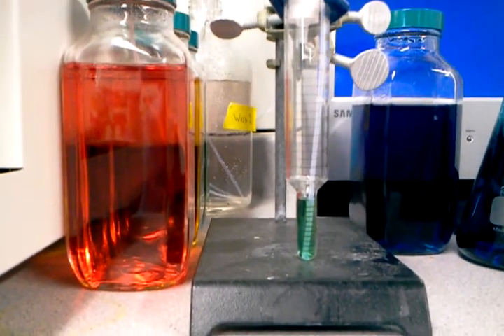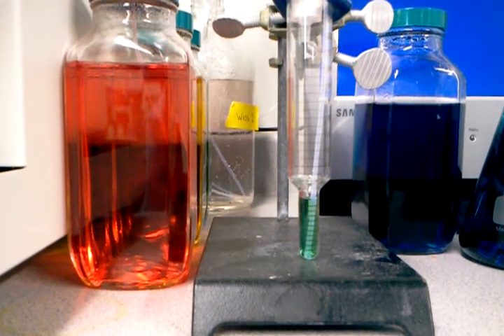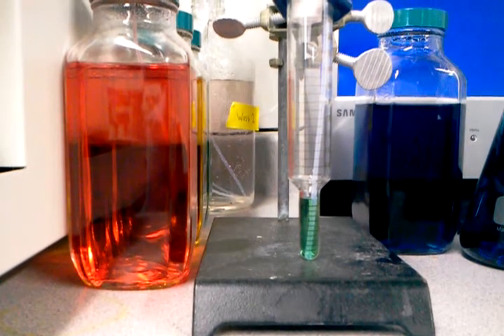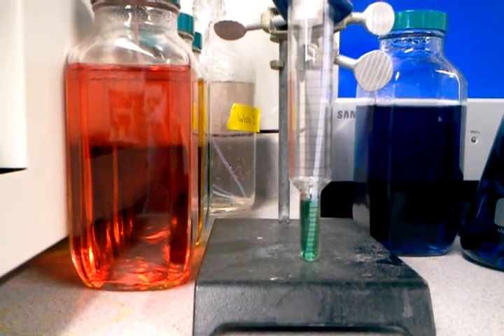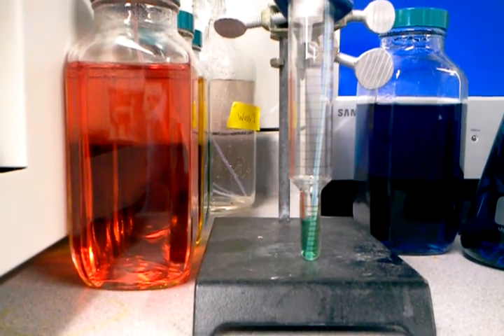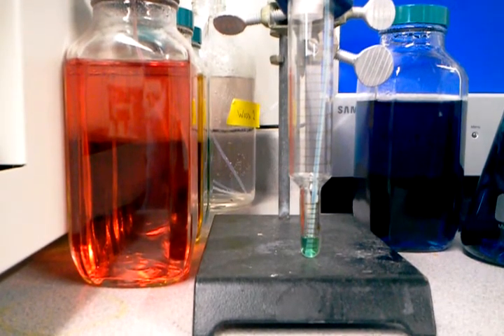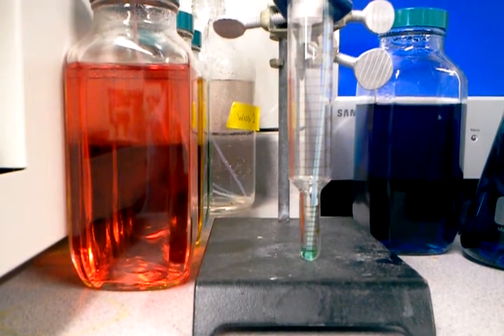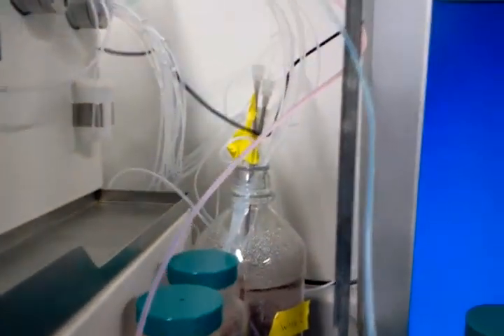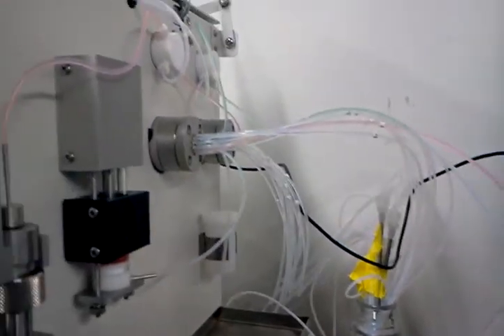The liquid volume is over one mil because of the tube that's inserted into it. The plunger is now moving to the right position. What we will see is the green liquid starting to be pulled into the tube. I'm pulling at five mils a minute which is a gentle flow rate. If I track and follow the sample you can see the end of the sample being pulled in.